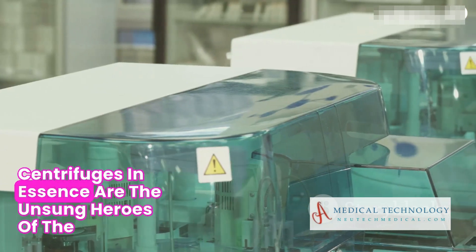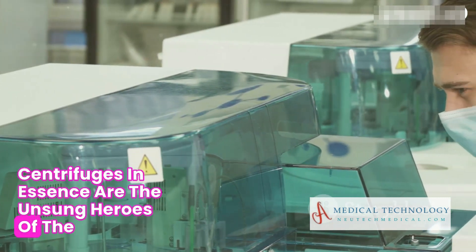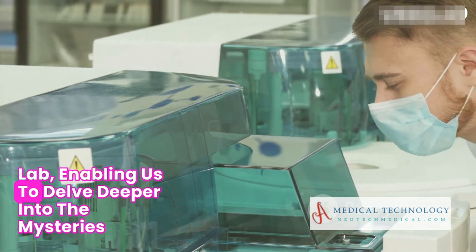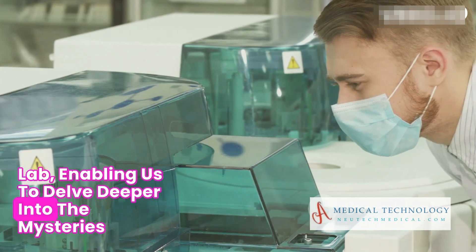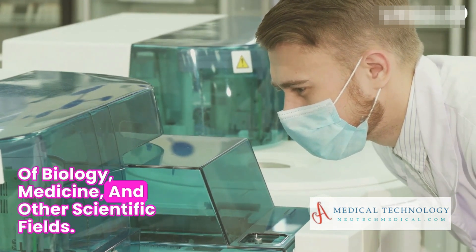Centrifuges, in essence, are the unsung heroes of the lab, enabling us to delve deeper into the mysteries of biology, medicine, and other scientific fields.